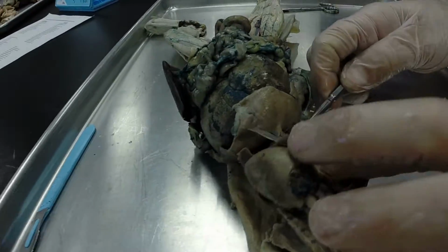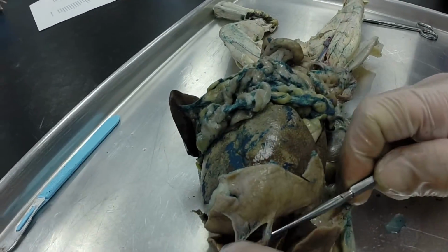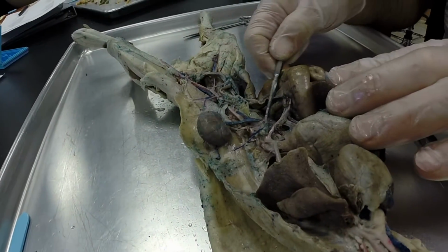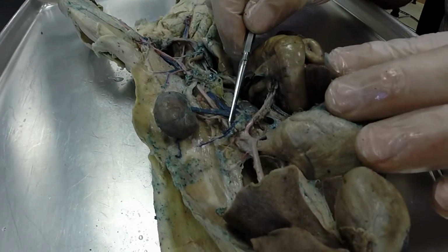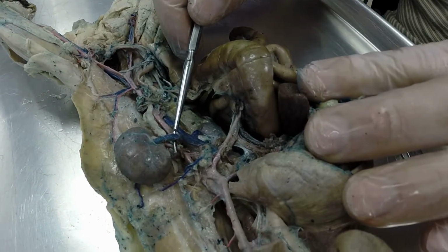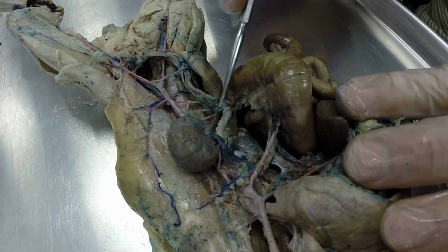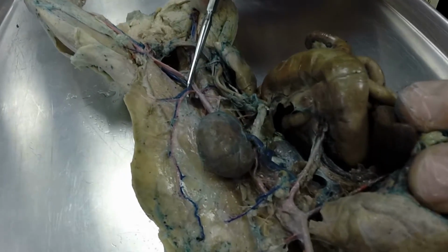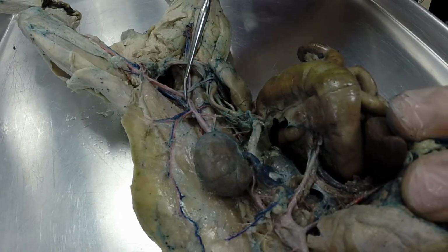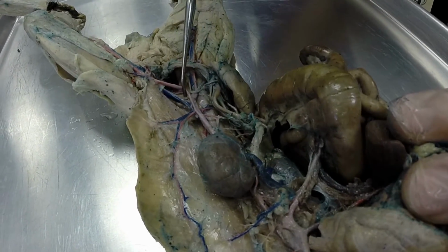Now, if we come posterior to the heart, we have this vessel, which is called the post-cava, right there. And if we find our post-cava, you can see it right here. Here would be your adrenolumbar vein. Here would be your renal vein. Here would be your iliolumbar vein. This would be a left. And then when the post-cava branches, it branches a little bit differently.